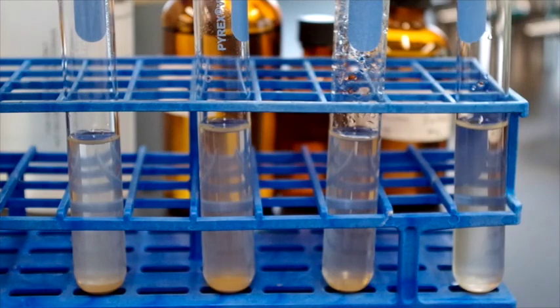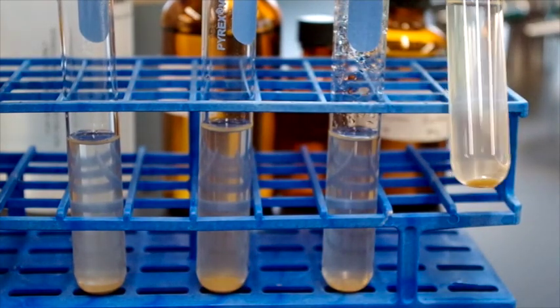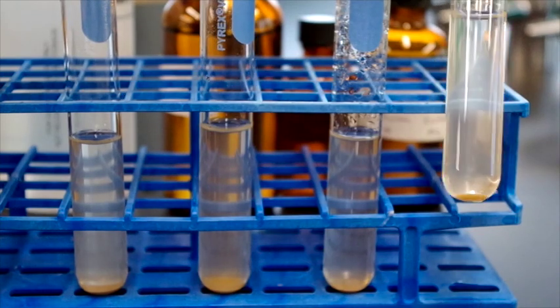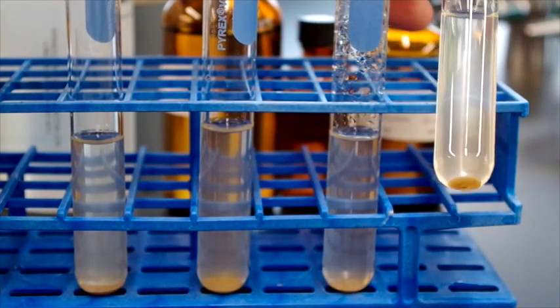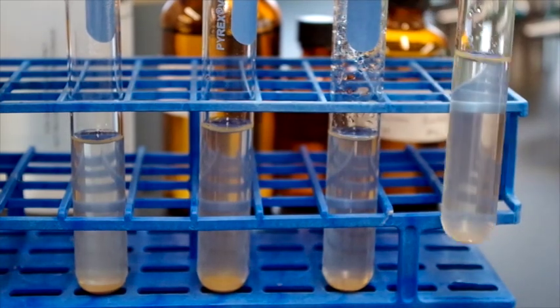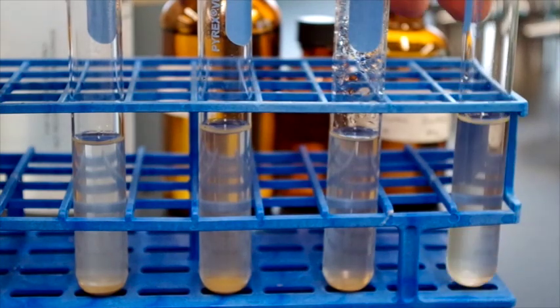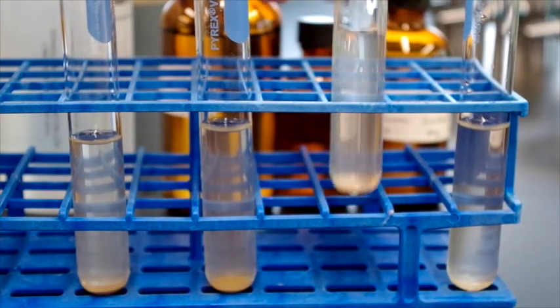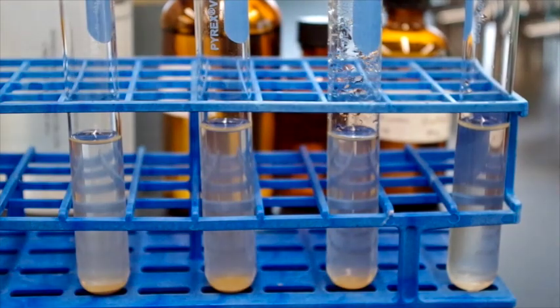And then lastly, the sodium sulfate is similar. Sulfates are widely soluble, so the mud that's in this water has been reduced. However, the discoloration of the water is still present. The clearest water appears to be the one with the potassium aluminum sulfate. So that's part D. You'll be answering questions about that in your report.